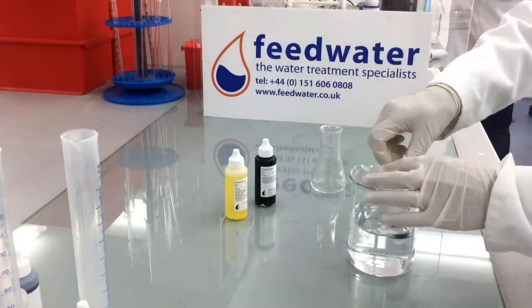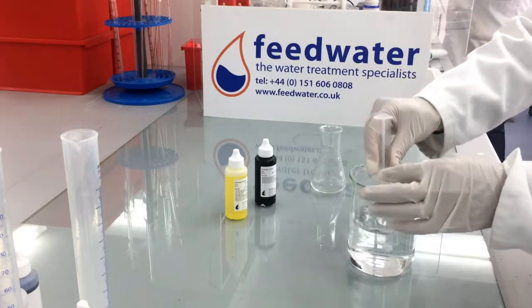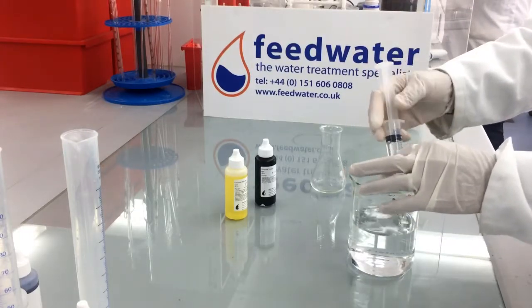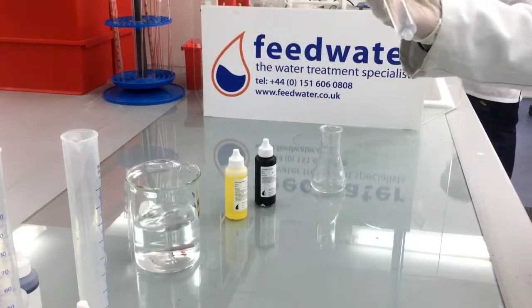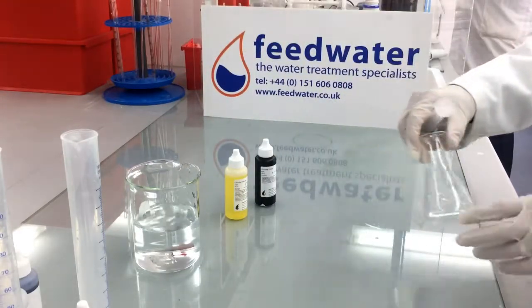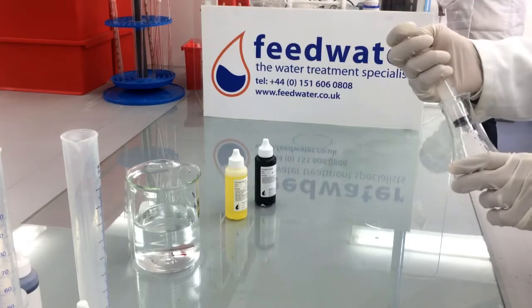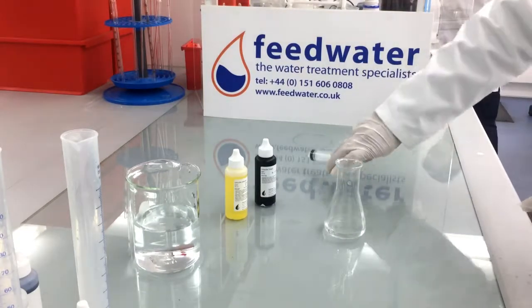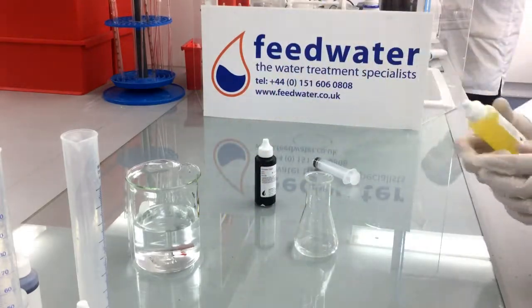You can take various sample sizes for this and it will determine the number of ppm per drop. We're going to take a 20 ml sample, so each drop of titrant with a 20 ml sample will give you 10 ppm of chloride.